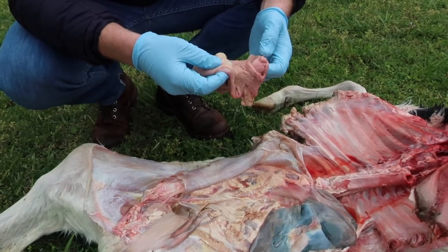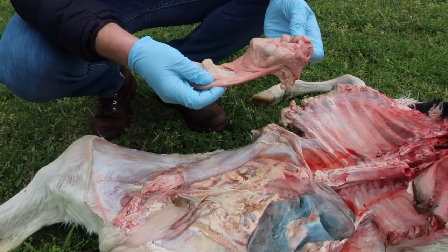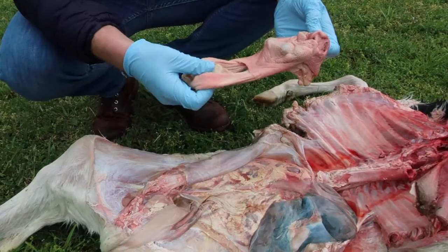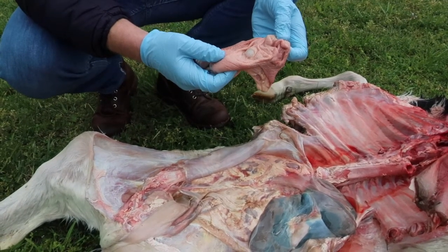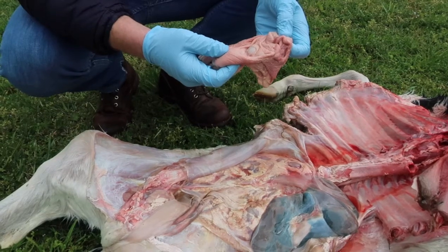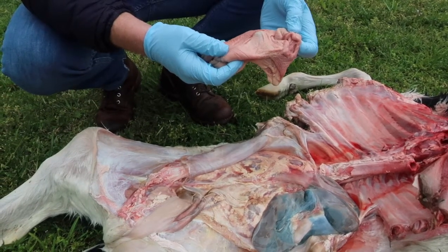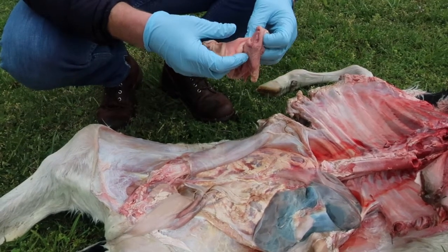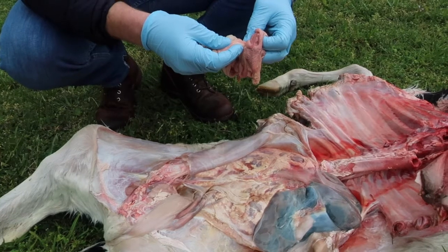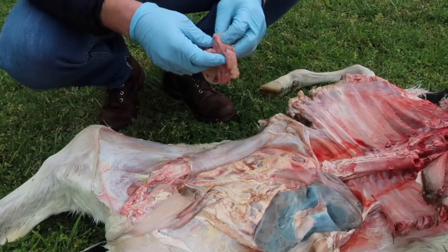That helps to bring milk during suckling past these areas straight to the abomasum, so that the milk doesn't find its way into the reticulum and rumen, where those microbes are able to sour the milk. So it's able to pass through those areas to the true stomach of the ruminant, the abomasum, and then the feed will move on into the small intestine.